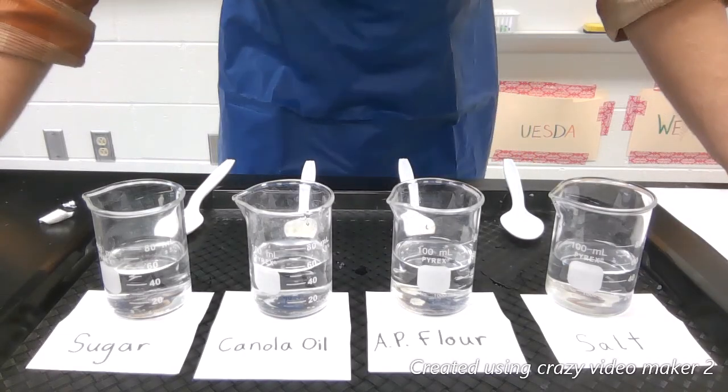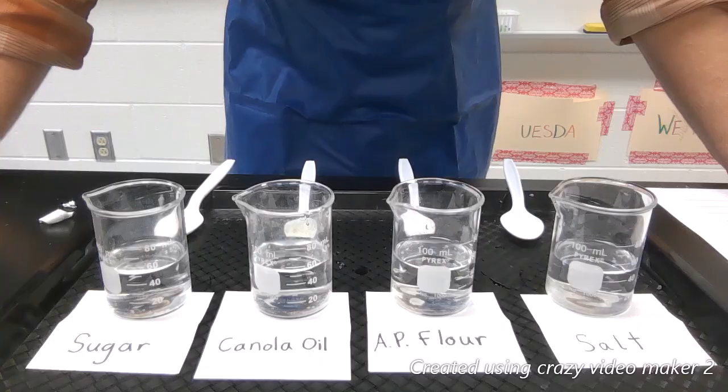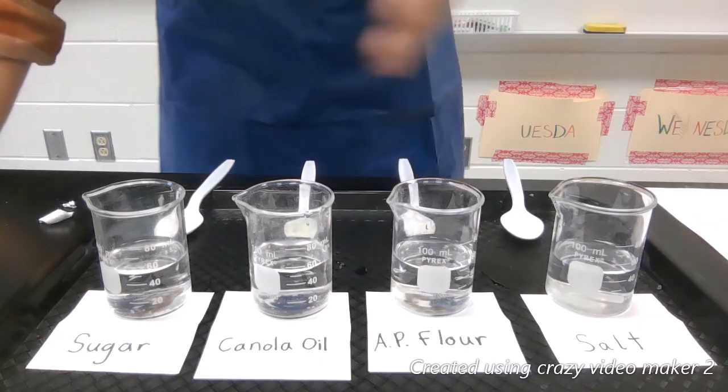Hello everyone, for this lab we're going to be looking at water as a universal solvent. I have four different materials.